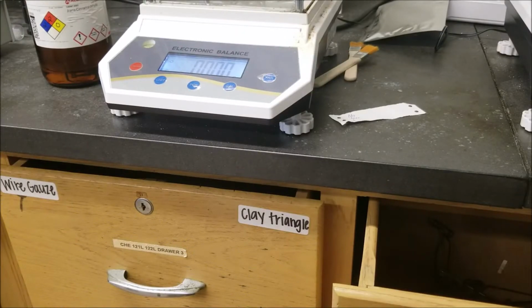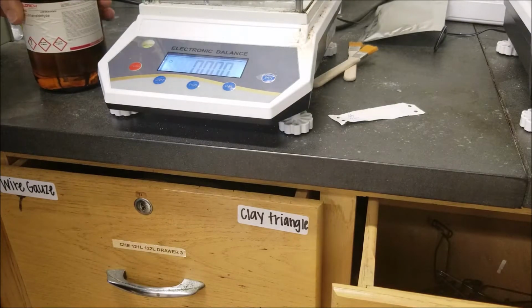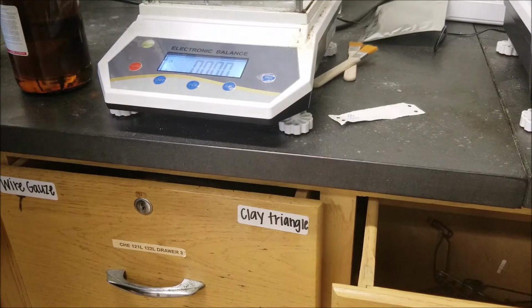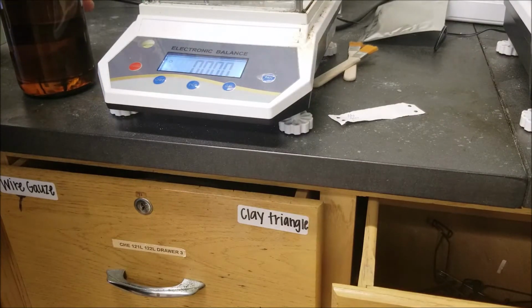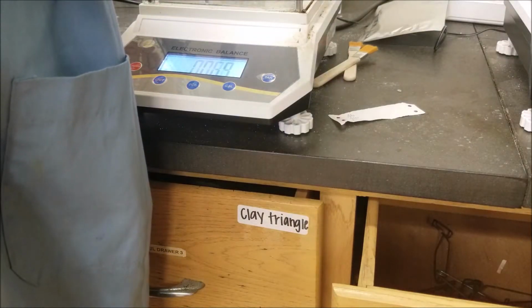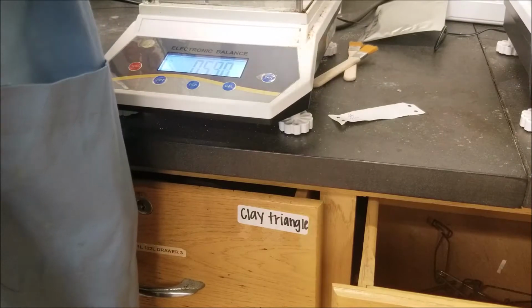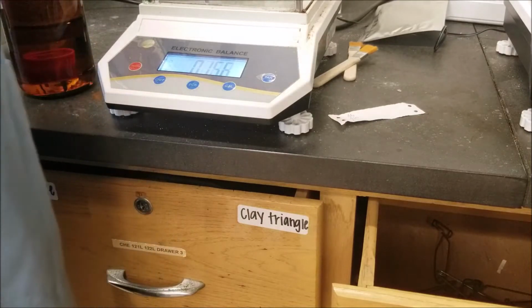Okay, so at this point, I'm going to try to add my trans-cinnamaldehyde to my flask. I don't need to add much, but I should be able to add enough. It's not fully a chalcone, but it's close enough that we should be able to see the reaction. Let's see.